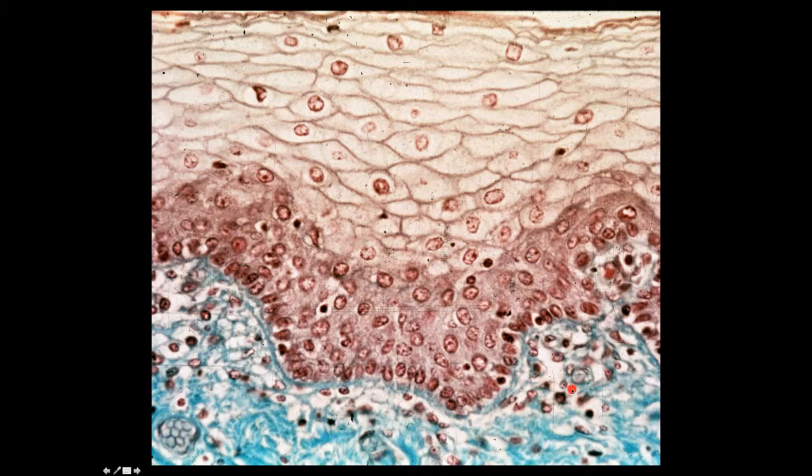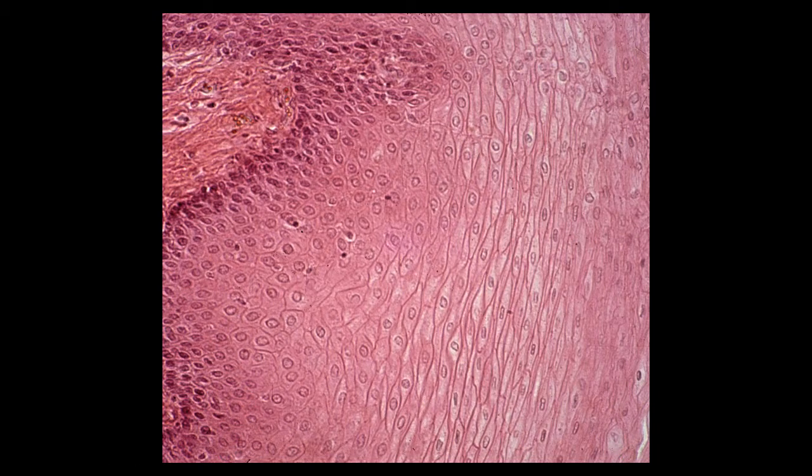Here is connective tissue underlying the epithelium, so in the lamina propria if you want, and I don't expect you to recognize this right now, but this is probably a profile of a small nerve. I also don't expect you to pick these out right now, but these cells might be melanocytes. Here is another profile of non-keratinized stratified squamous epithelium. The surface is actually off the histological image, so it's down here. But again, a stratified epithelium, and notice that as you're going towards the surface, the cells are getting flat, so we define it as a stratified squamous epithelium.